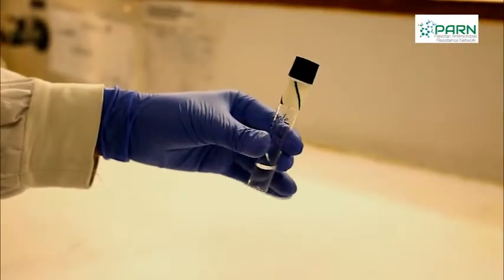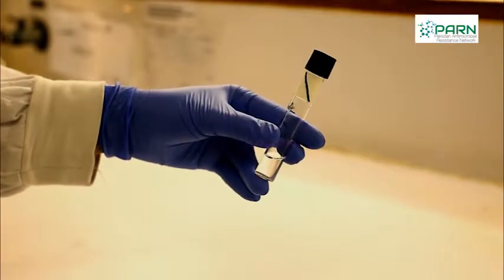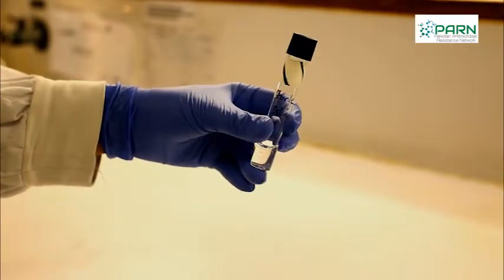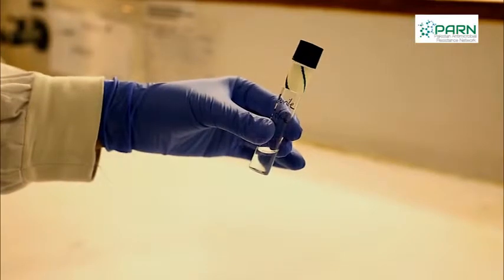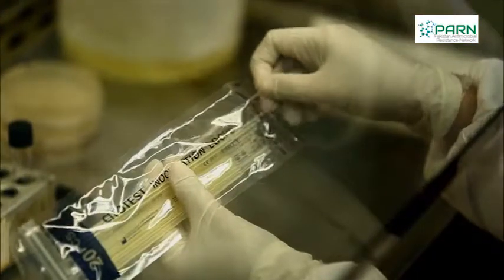After doing this, suspend the organisms in 2 ml sterile saline, preparing a smooth suspension.